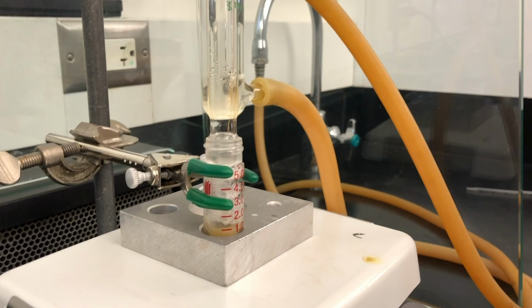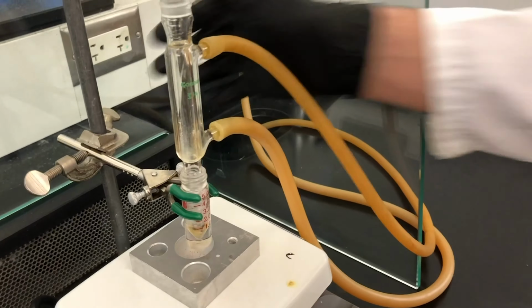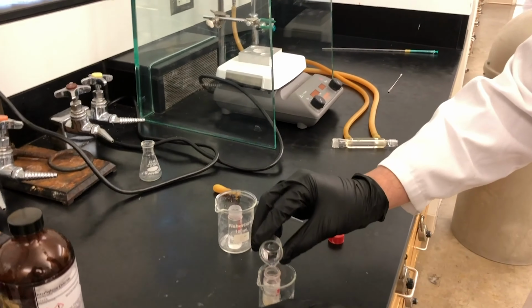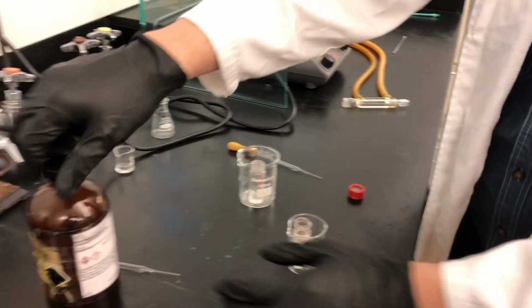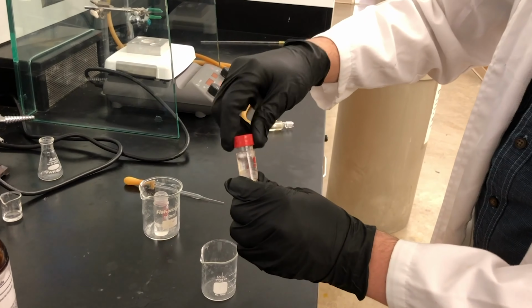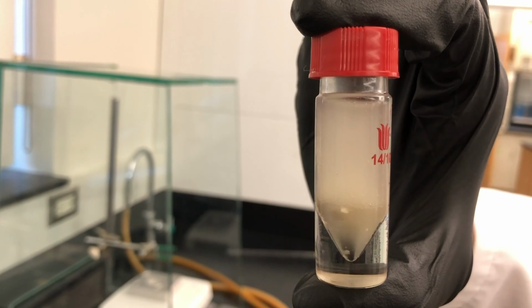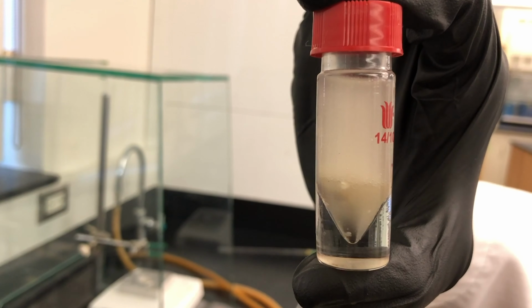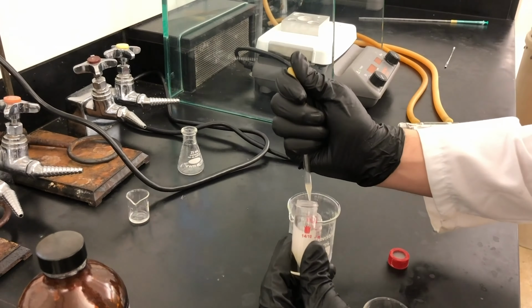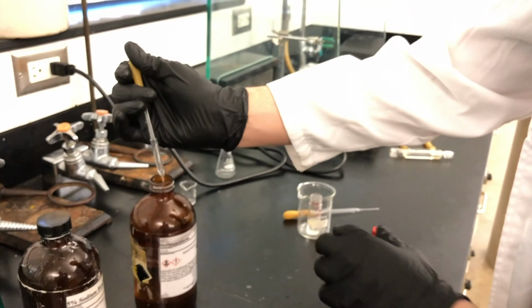After 1 hour of reflux, we allow the reaction mixture to cool down to room temperature. Before extraction, we add 2 milliliters of distilled water. Now I'll use methylene chloride to extract 3 times. We'll put a lid on the conical vial, and then we'll shake it up to mix both layers together. The bottom layer contains our alcohol, and the top layer contains the carboxylic acid. We'll take out the bottom layer and place it in a separate conical vial. We'll repeat this procedure 2 more times.